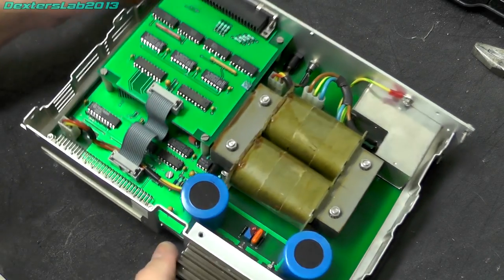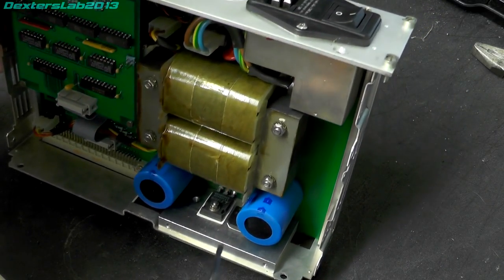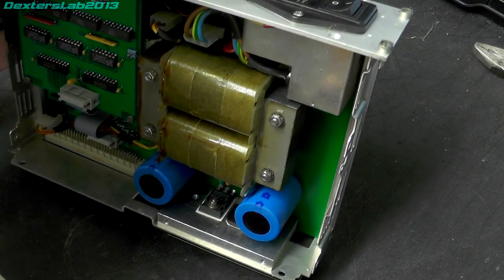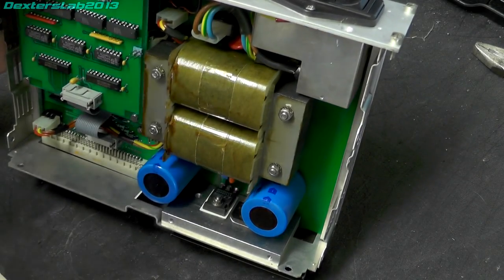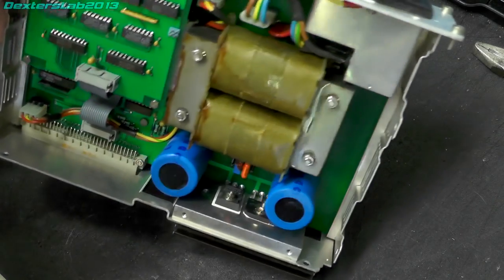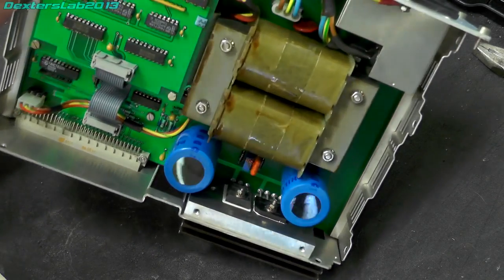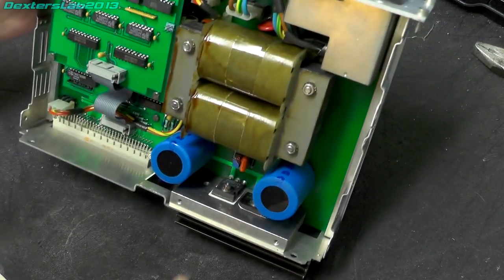There's a couple of devices down on this heatsink. We've got a bridge rectifier and an LT1084. So yeah, a fairly beefy old school regulator down in there. A couple of big caps. They are 22,000 microfarad, 16 volts, Philips branded. Let's see, Philips branded caps much.